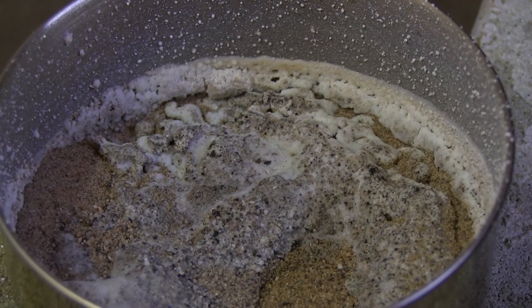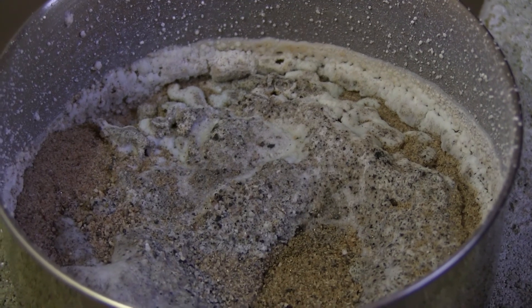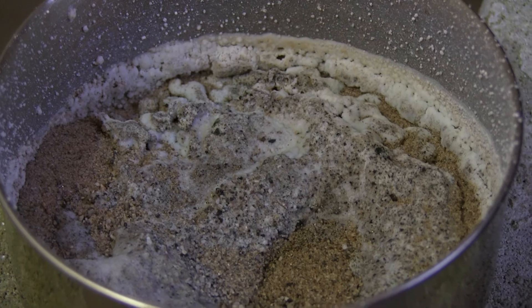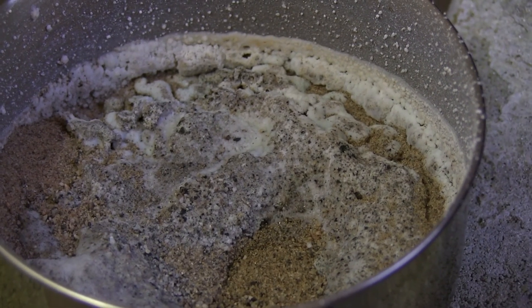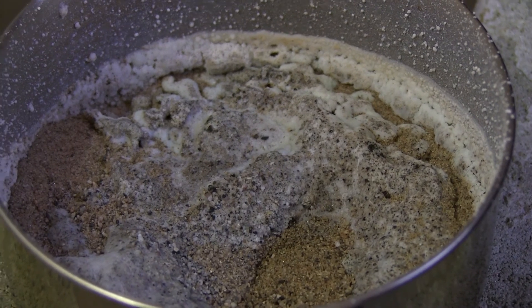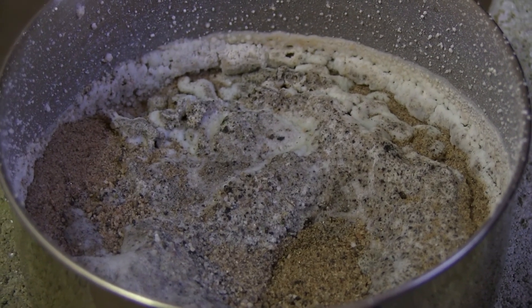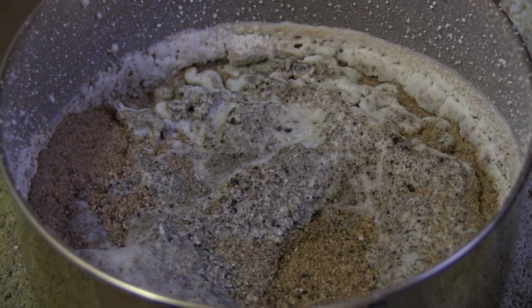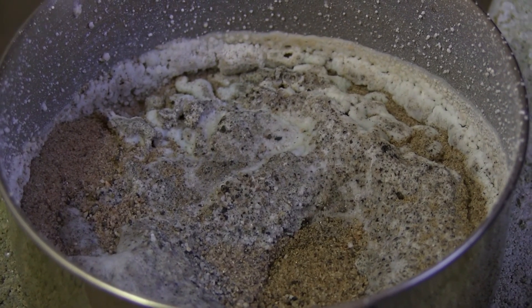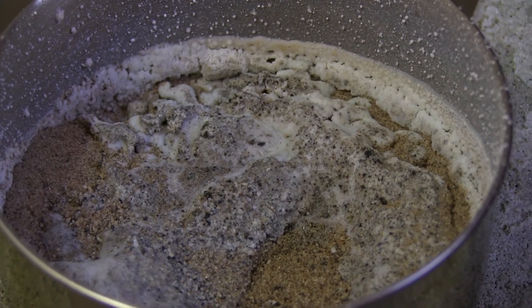So this is now what I am left with. This looks like solidified goo, and it doesn't melt or even turn into a semi-movable state — it's just a chunk. So now I'm going to wait for it to cool, and then we shall see what happens.